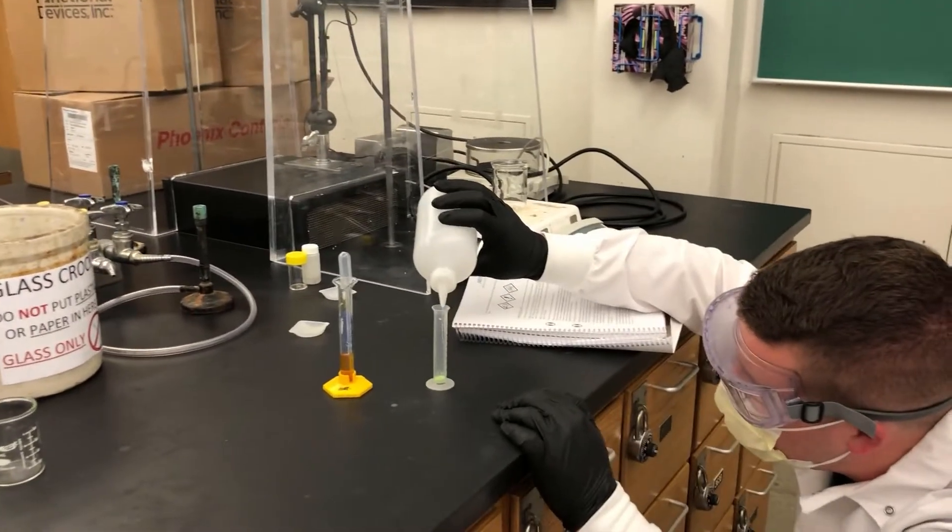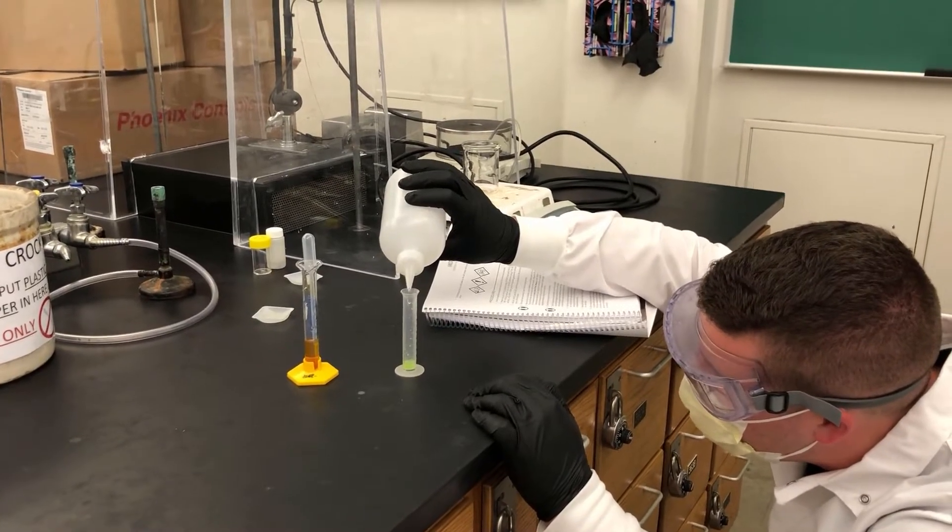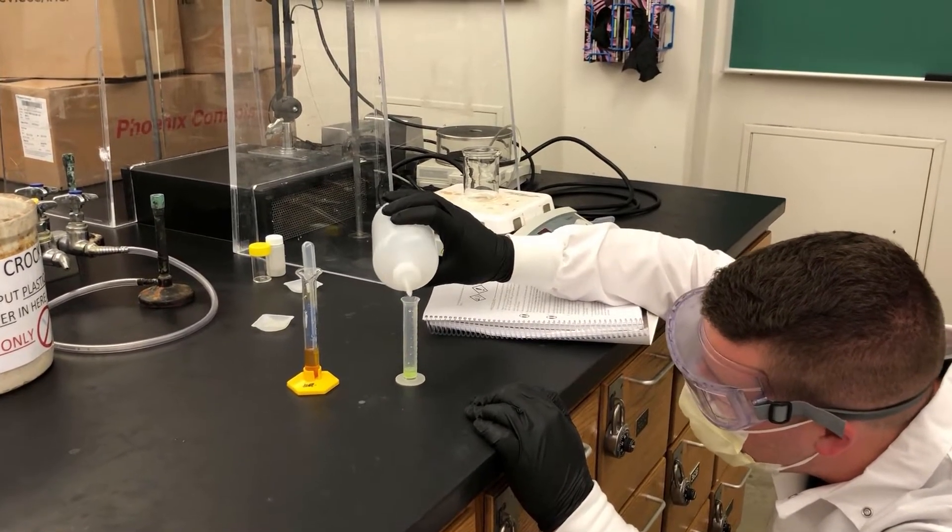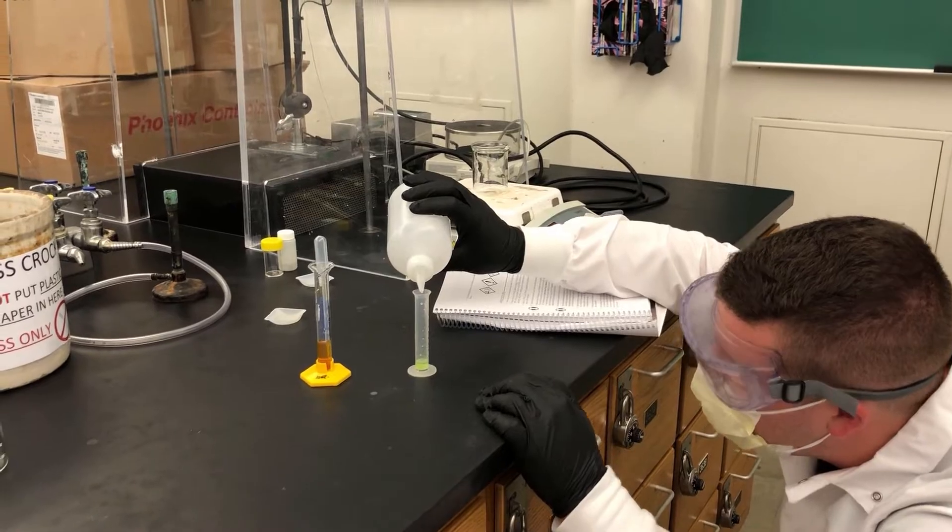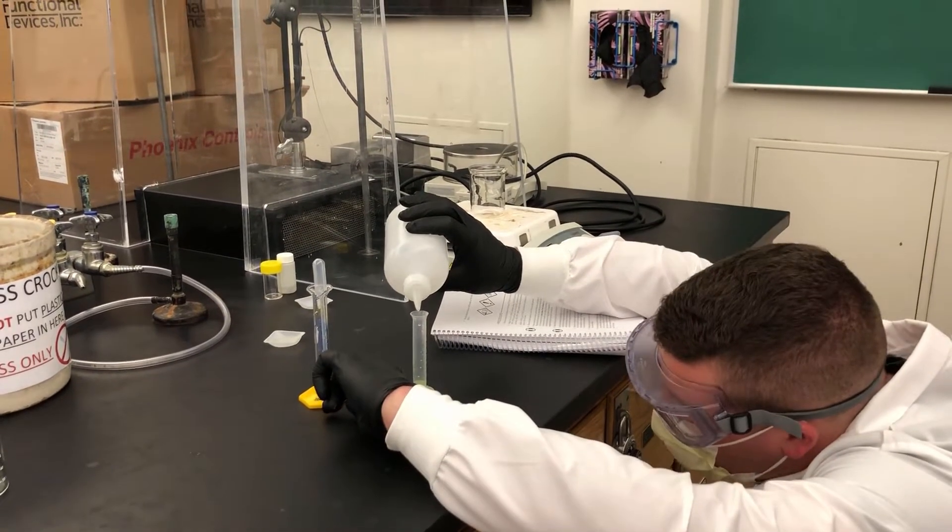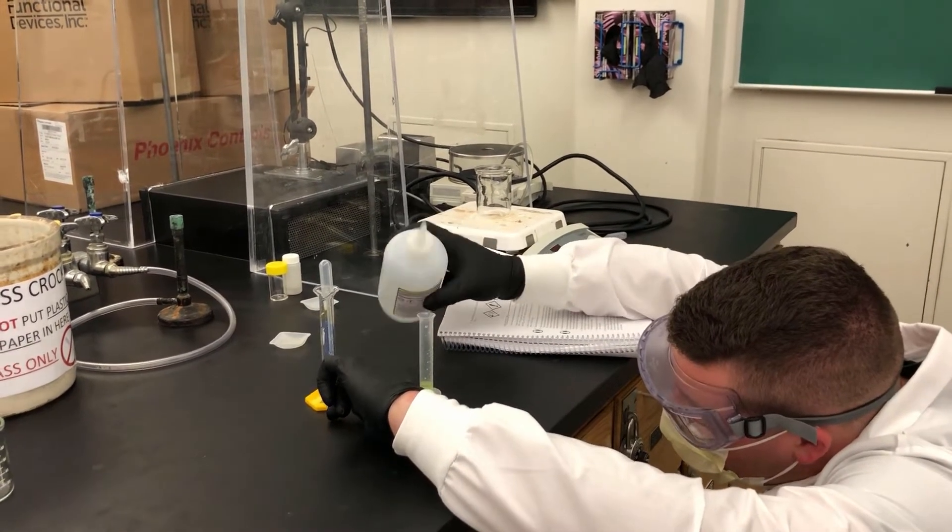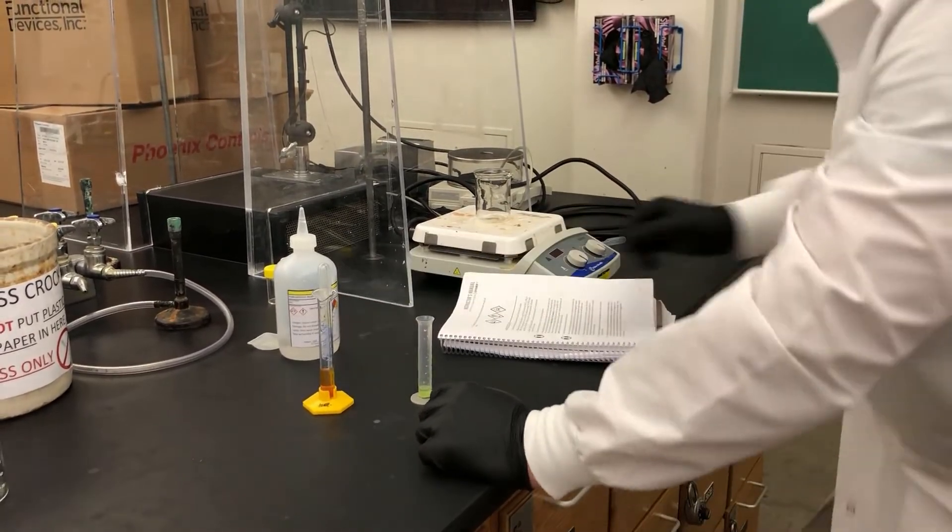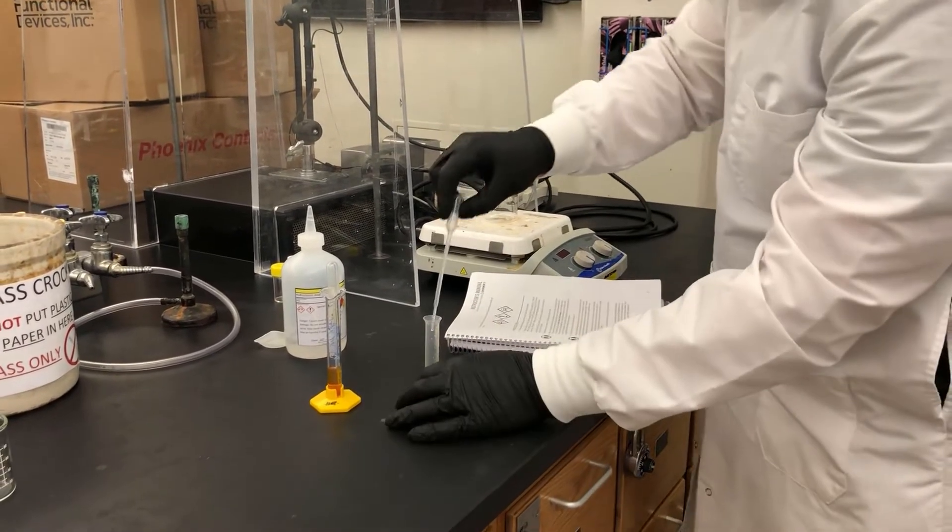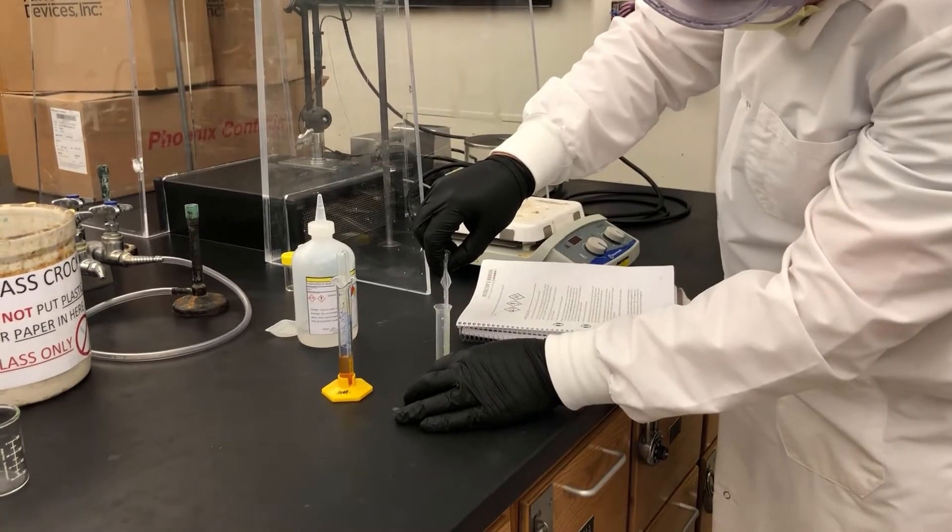And I'll add that just so the meniscus is resting on that 1 milliliter line. And likewise, he'll pipette up and down to mix the hydrate.